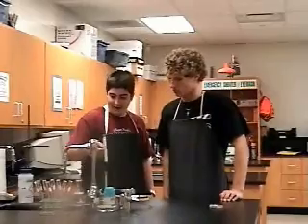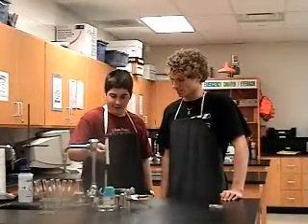Thing will start boiling soon. I hope so. Everybody else is. I don't know why ours isn't. It takes so freaking long.